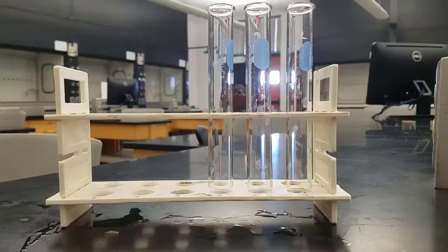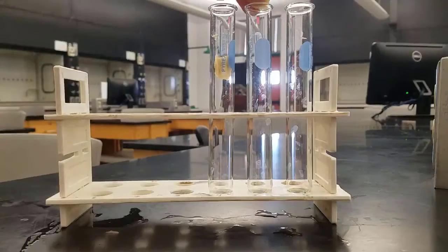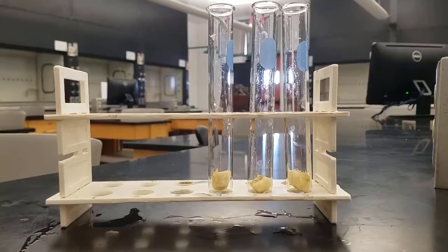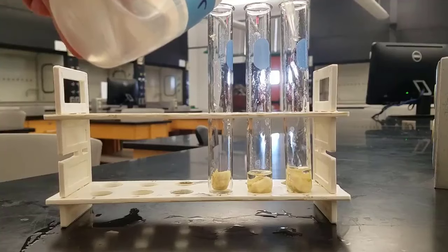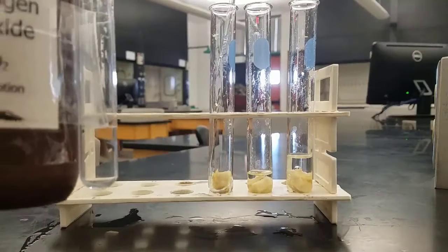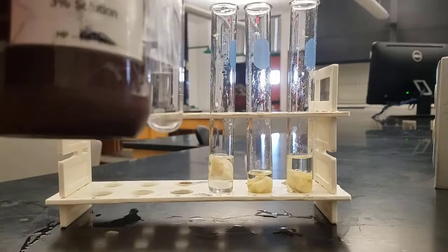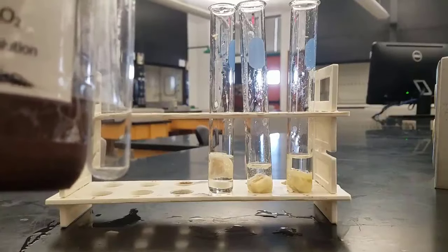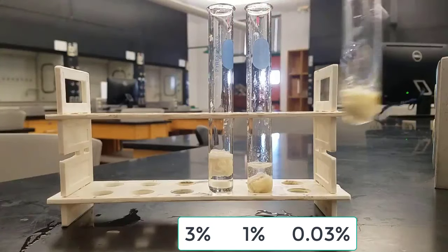For the last part, we're going to look at changing the substrate concentration — that means changing the concentration of hydrogen peroxide. Same experiment, we only change the substrate this time. Banana goes into the test tubes, then we add water, wanting a total of about three mils in each test tube. We didn't add any water to the first one, we added two mils to the second, and about three mils to the third. Now here comes the substrate: we put pure substrate — a three percent peroxide solution — into the first test tube. The second has about a one percent concentration, and in the third we only added a couple drops, so a very low concentration of roughly 0.03 percent.